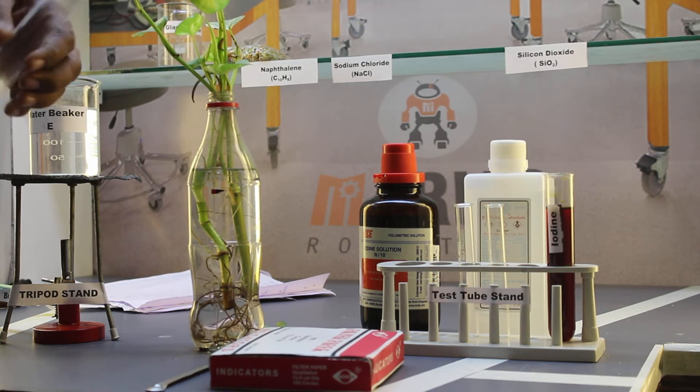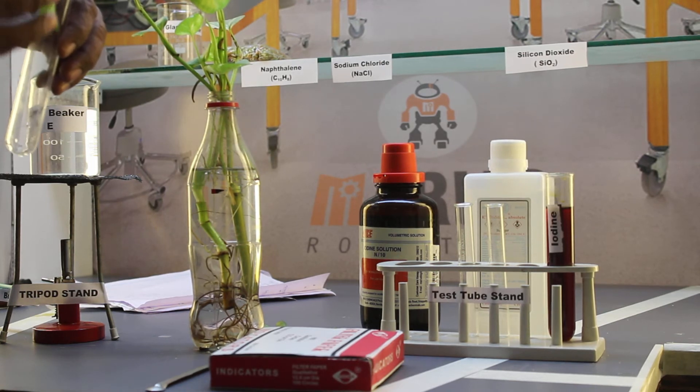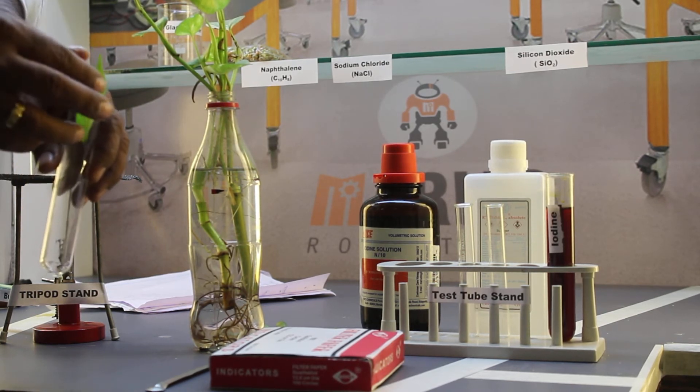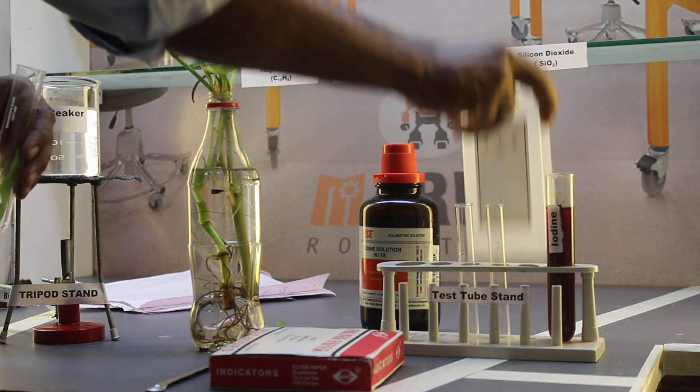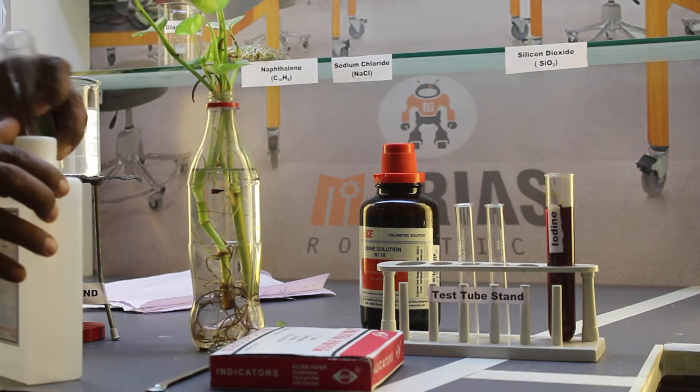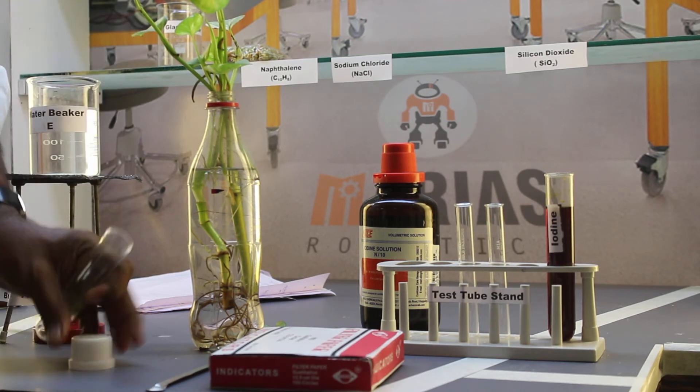The detached leaf should be placed into the test tube, and then the test tube is filled with ethyl alcohol.